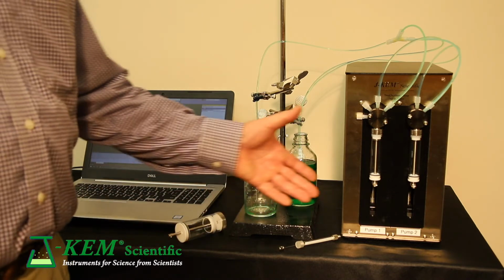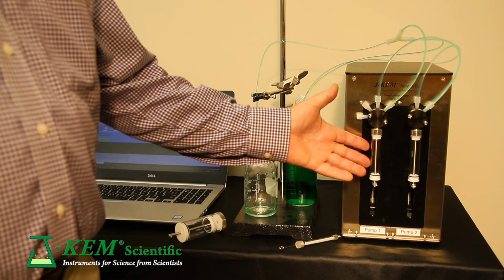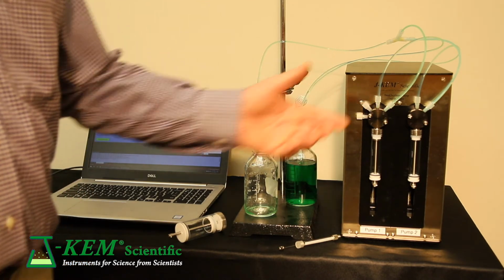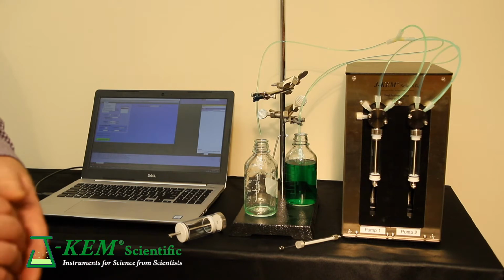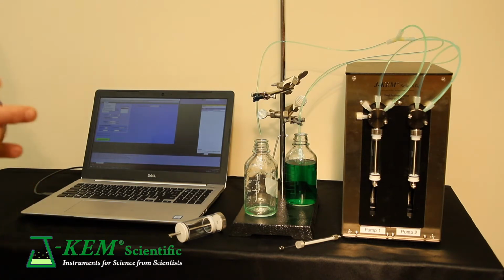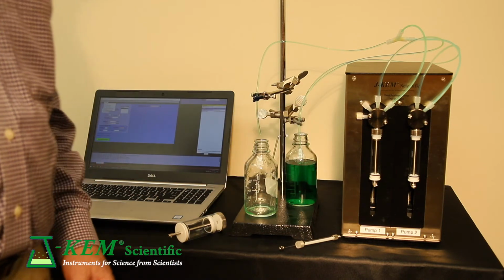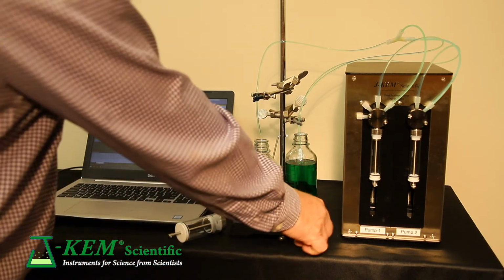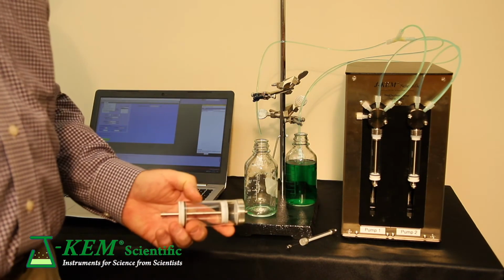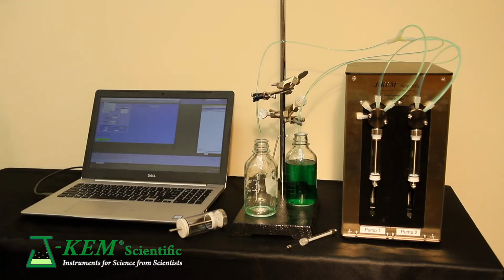Regarding the pump itself, it has a 100% inert flow path. It's a glass syringe and a Teflon valve, so you can dispense any aqueous solution or organics or strong acids. We even have customers who dispense concentrated sulfuric acid from this. The syringes themselves, as I said, are glass and Teflon, and they come in a variety of sizes, anything from a 10 microliter syringe up to a 50 milliliter syringe you can put on here. In this case, I have this fitted with a 10 milliliter syringe.